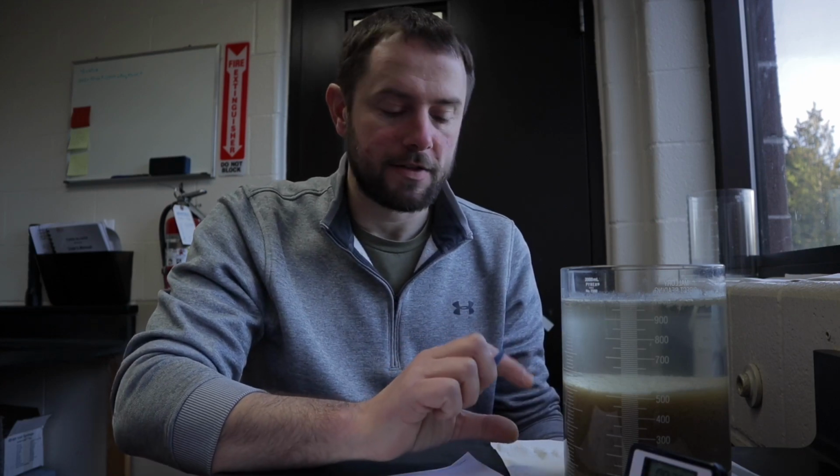So now that the settleometer is all done, we can calculate our SVI. Now the SVI is the sludge volume index, and essentially it's the relationship between how much sludge there is and the space it occupies. Now this is a potential for the sludge because a settleometer is not dynamic like a clarifier, but it's useful in setting our return rates and understanding the liquid-solid separation that's taking place.